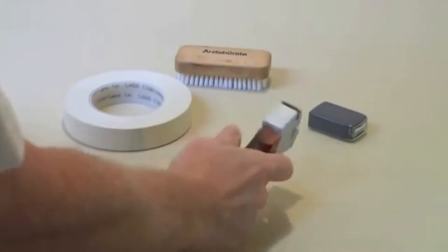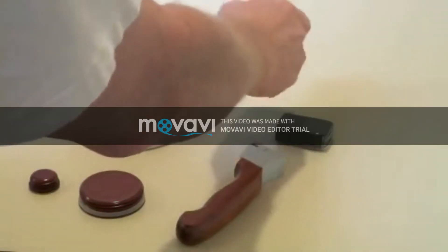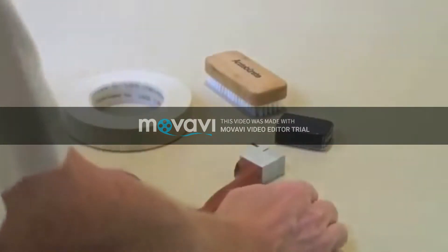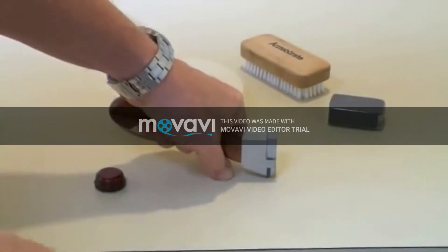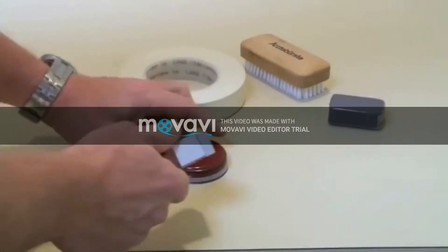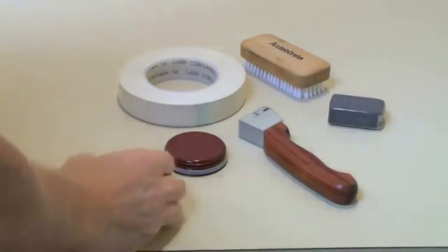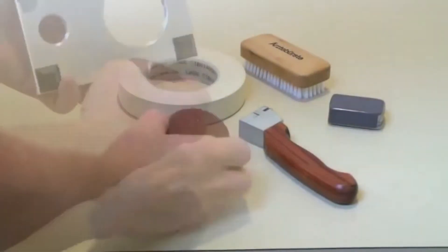A testing kit consists of a cross cut test handle and a brush to brush off the cut areas. Press it on the surface that you want to cut and draw your fingers, being careful to avoid slipping off, in order to perform this test on these drum plugs.